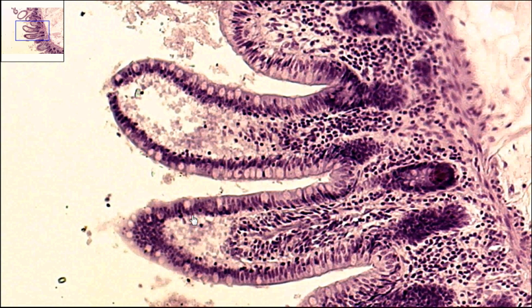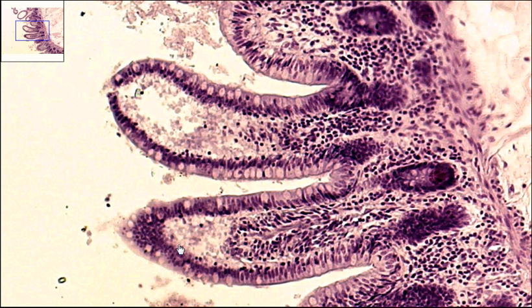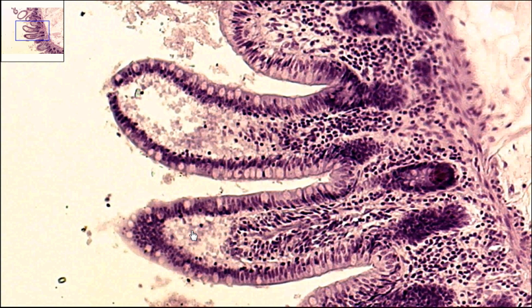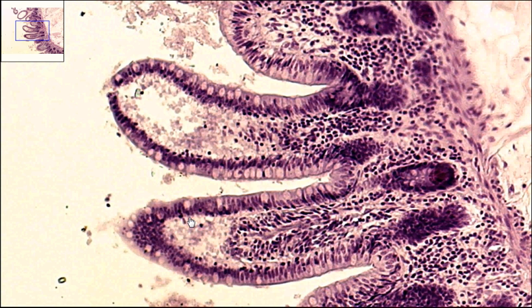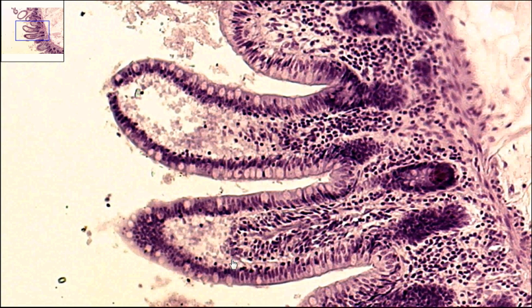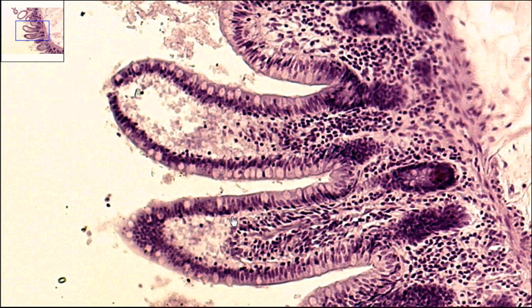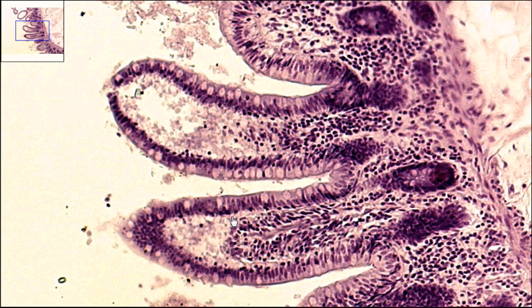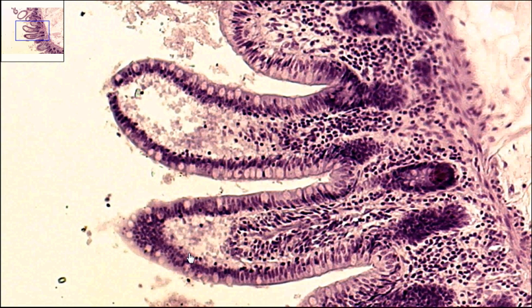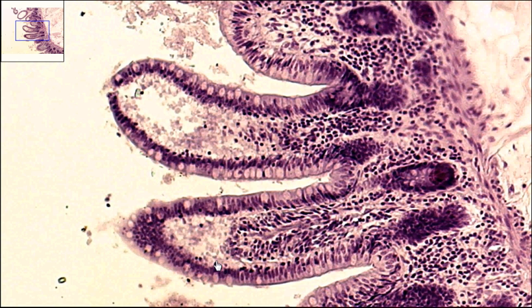This edge right here, or the difference between the dark purple and the lighter off-white, this is going to be the basal surface. The basal surface of the simple columnar is always the surface that is supported by connective tissue.